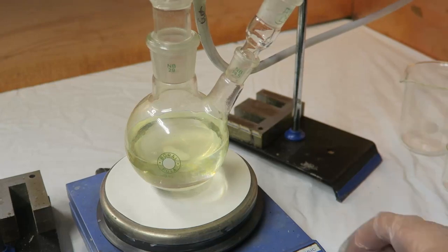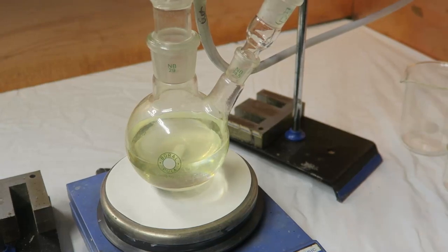Then, the acetaldehyde solution is added to an addition funnel. Finally, I've turned on the stirring and started dripping in the acetaldehyde solution.